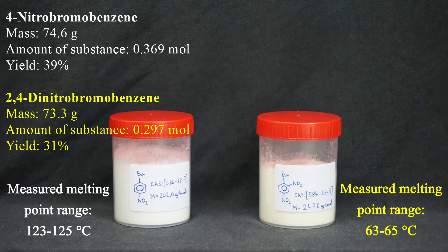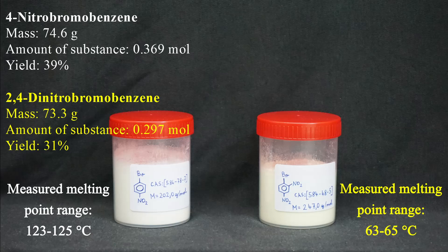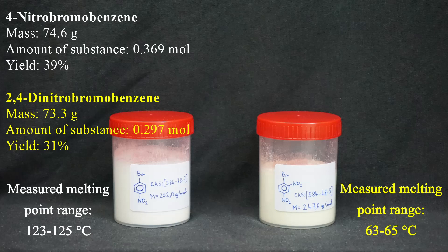So, for a quick recap: from 100 ml of bromobenzene, I produced 4-nitrobromobenzene in 39% yield and 2,4-dinitrobromobenzene in 31% yield. I have plans for both products, but it will take me some time to actually realize those plans as I have a lot of other things I want to do first. So stay tuned and I will see you on the next one. Bye.